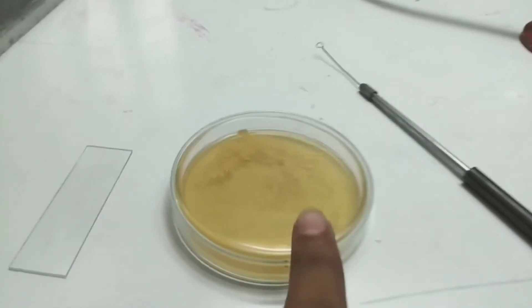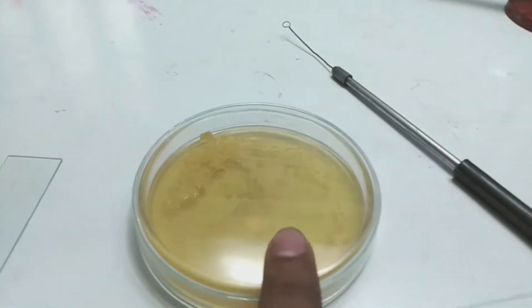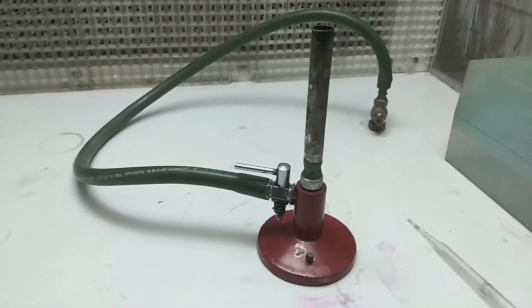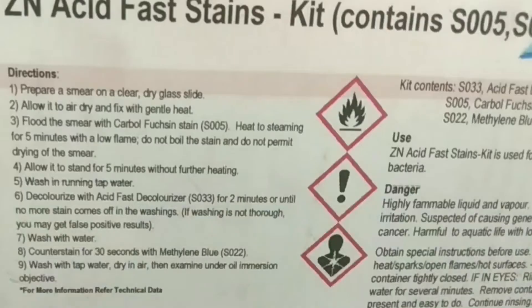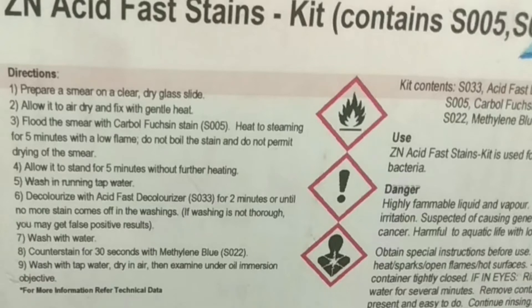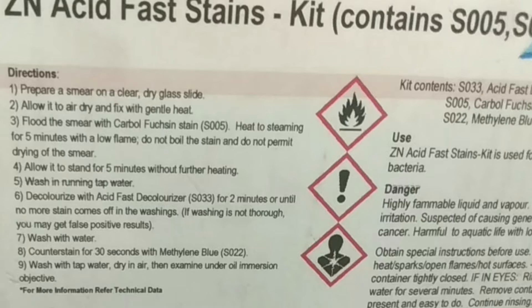We also require a Bunsen burner or flame for heating, a special arrangement of two glass rods on which we set the slide, a Mycobacterium species culture, an inoculation loop, a clean glass slide for making a smear, and a Bunsen burner for heat fixing. The kit also contains a step-by-step procedure card.